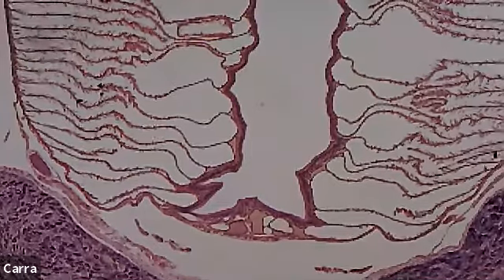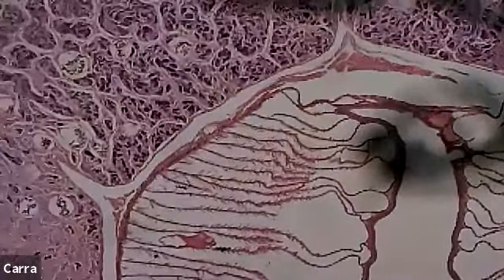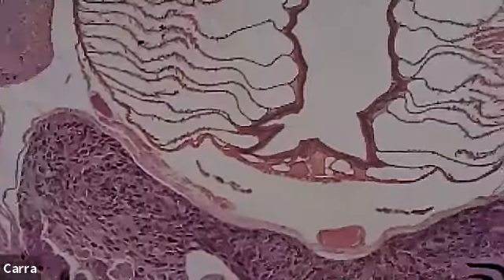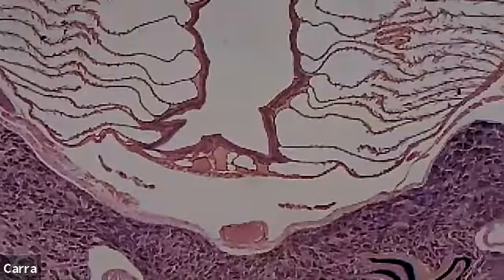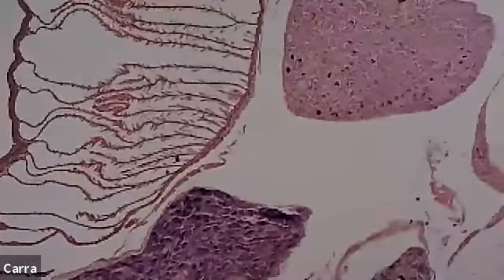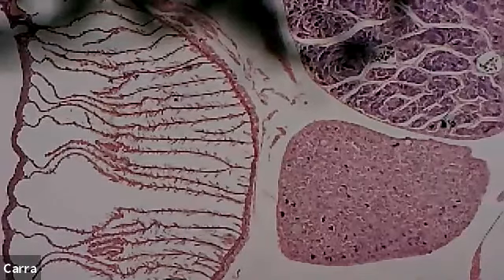All right. And then all of the space around that, which you can see, it's kind of thin here and a little bit bigger there, and then opens up a lot on this side. That's all going to be your formal coelom, right? The actual coelom or the cavity that's formed in coelomates. All right. And so when we have that formal cavity and it's called a coelomate, that means that it's going to have that coelom, one.